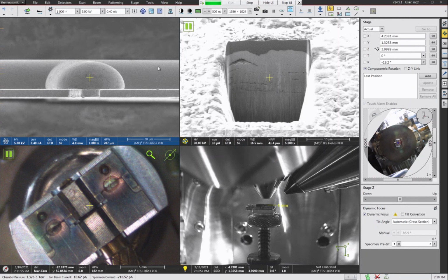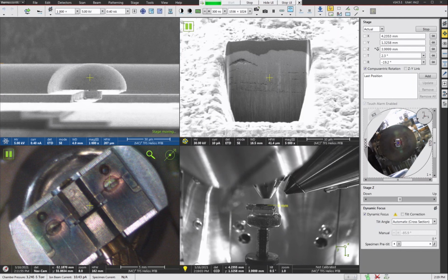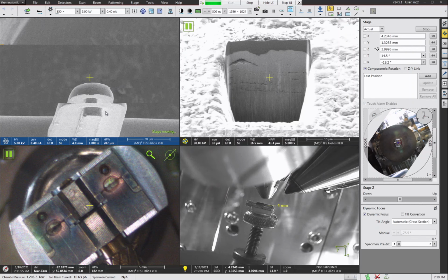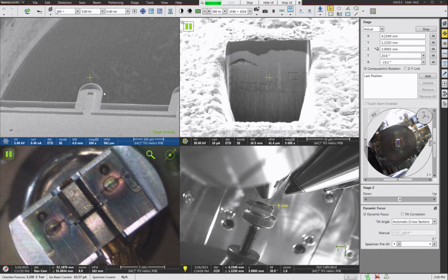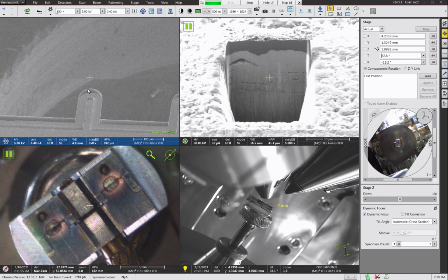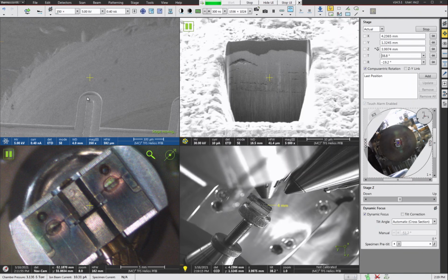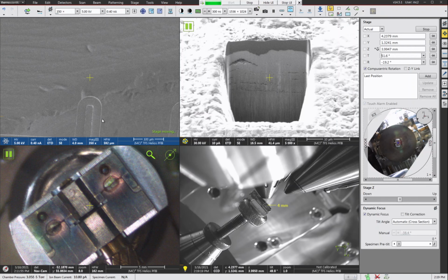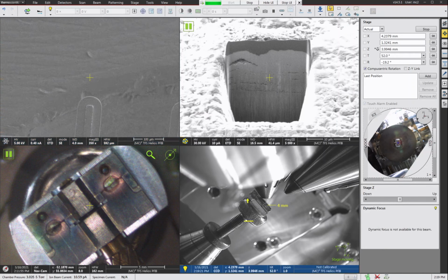All right, so let's go ahead and tilt to 52 degrees because we're going to do all our work with the fib at a 52 degree angle. You can see here, it looks like my grid fingers are a little bit on an angle to the right. That's not a real big deal. We're going to cut these things into a straight pillar, no matter what that angle happens to be. So not a big problem.